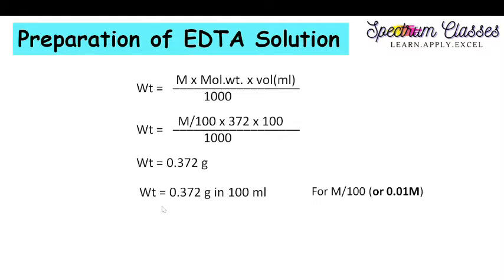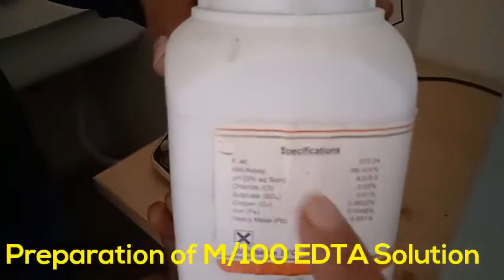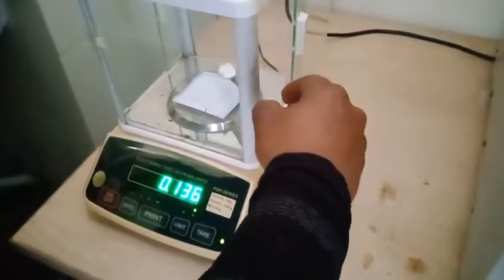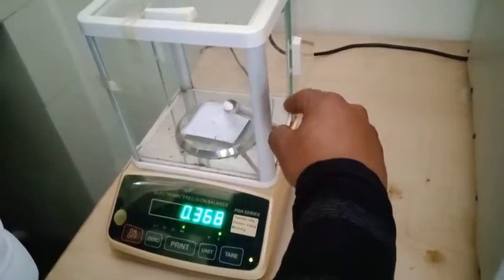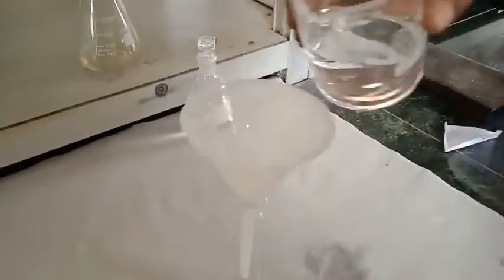Now I am going to show you the lab activity. Here is the disodium salt of EDTA and its molecular weight is 372. From the calculation part, I get to know that I have to weigh 0.372 grams to prepare 100 mL of M/100 EDTA solution. Here you can see the weight.